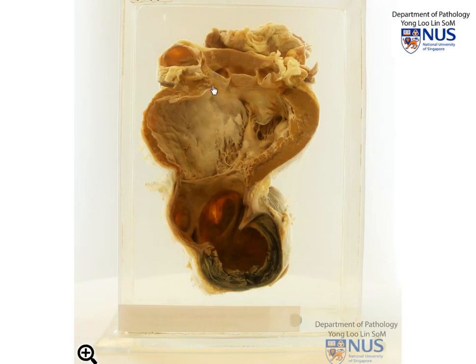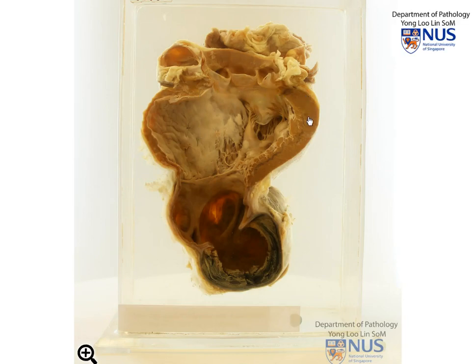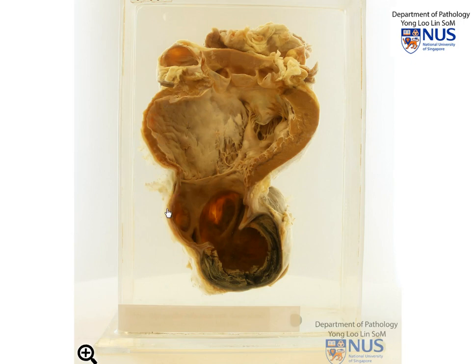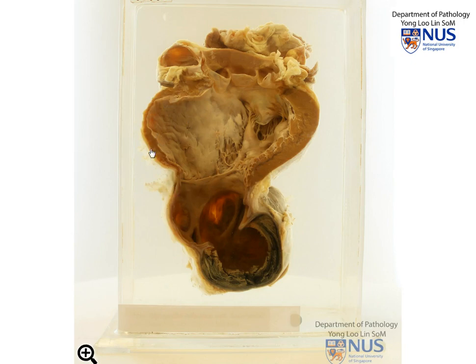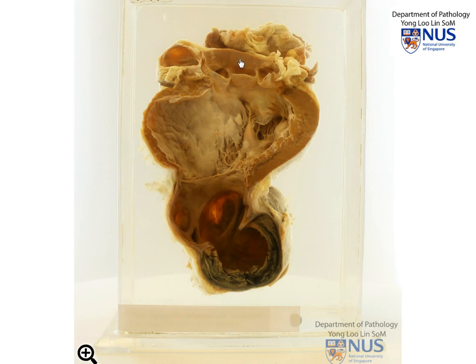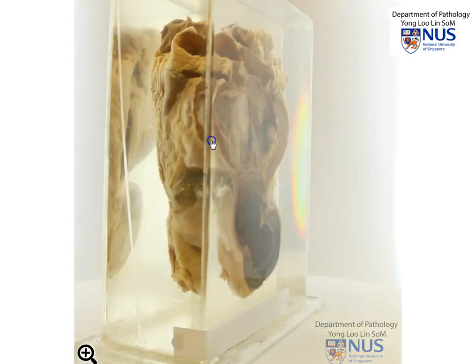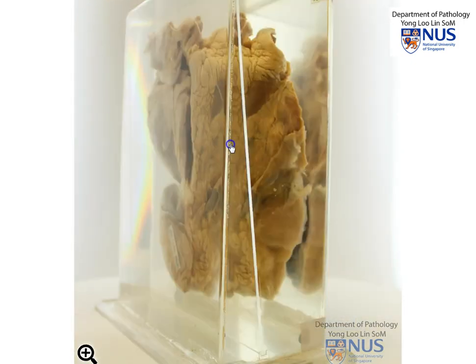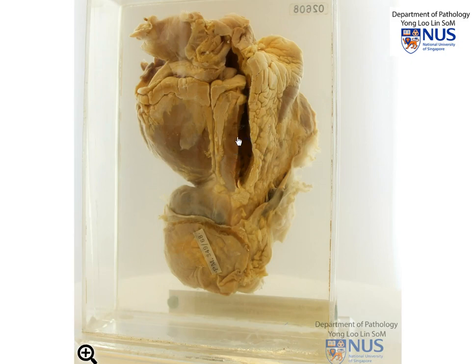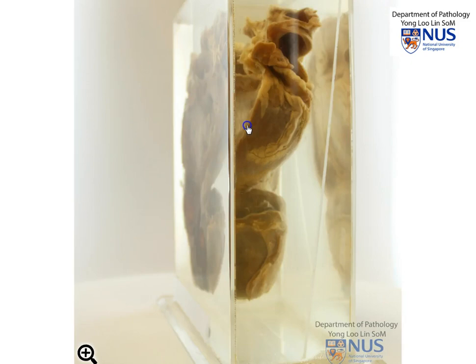What we're looking at here is the specimen of the heart, and this chamber that has been opened for you is the left ventricle. This very grossly abnormal area is the apex of the left ventricle. Here is the aorta and the aortic valve, and we're just going to turn it around to orientate ourselves. This would be the right ventricle posteriorly, coming back again into the left ventricle.